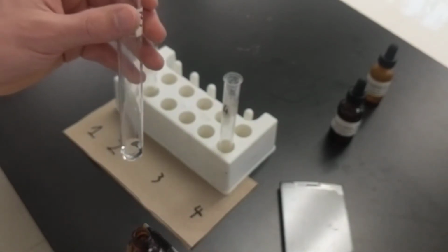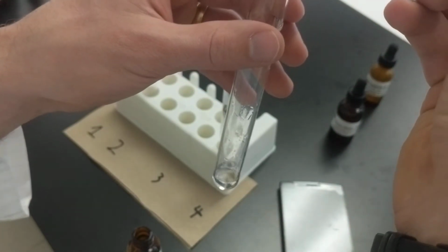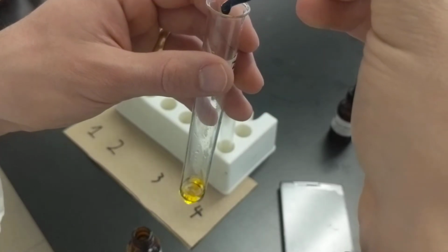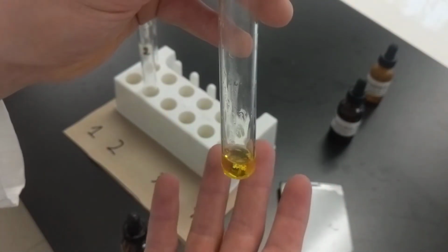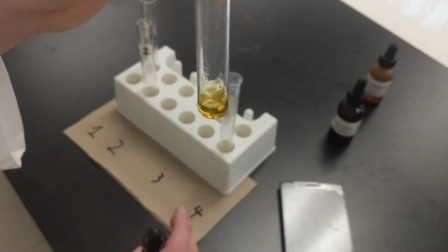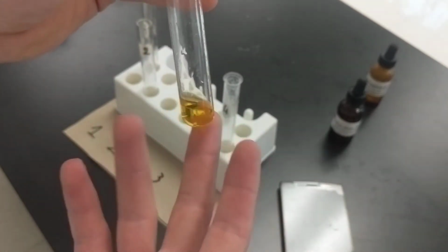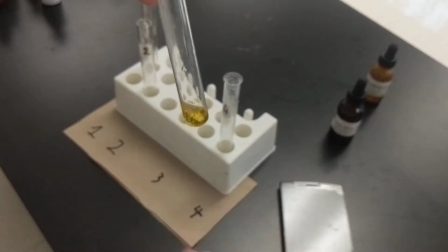And now I'm going to be adding blue. So blue is like very, very blue, and I'm adding 5 drops. So 1, 2, 3, 4, 5. I think the one may have dripped off, so just add one more, because I think it was on the outside. And we have not blue, not colorless, but yellow. Kind of random, sort of. It's not random, but kind of looks random. Why is it yellow? But anywho, chemical reactions. So color change. No bubbles this time, just a color change.